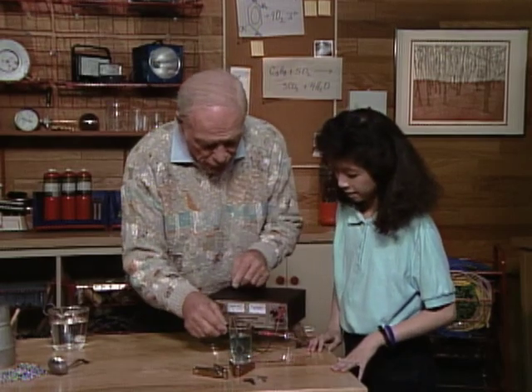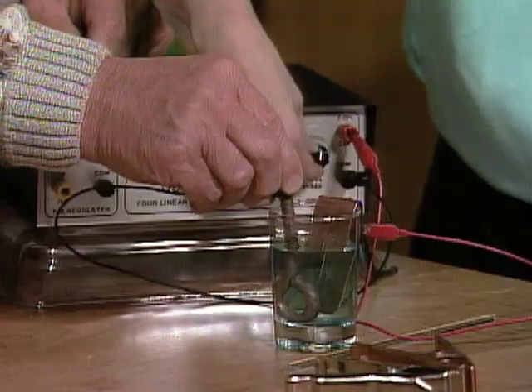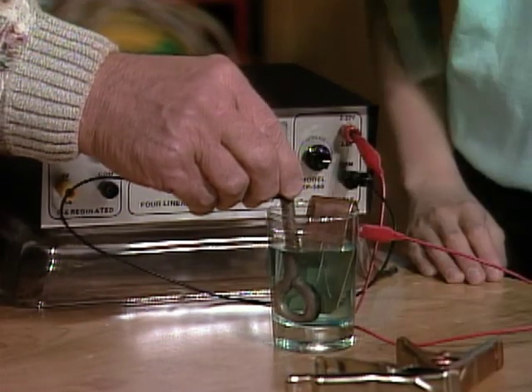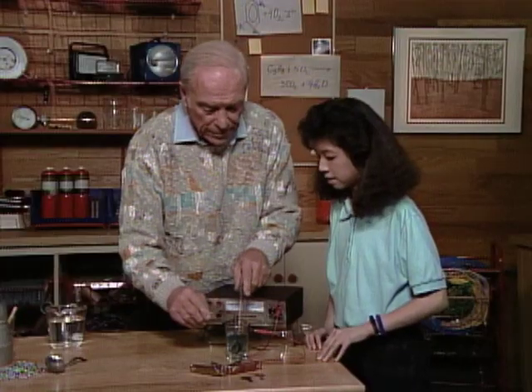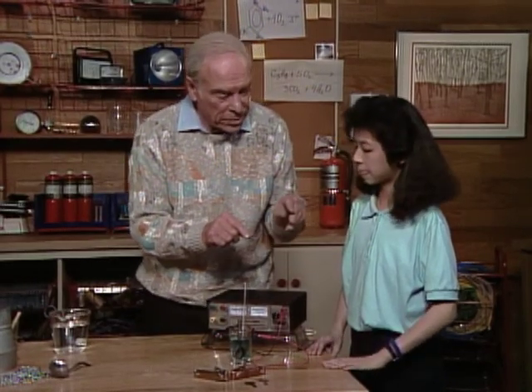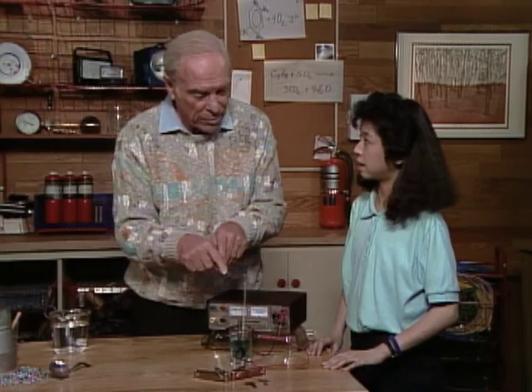Now what I'd like you to do is to turn on the current — right there, turn it up. About there, and I'm going to stick this stirring rod in between so they can't touch. Now what's happening is the copper that's in the solution — as the electricity goes through the solution — it's pulling it out and depositing it on the eye bolt. And the current coming from the other side is taking copper from the copper sheet and putting it in the solution.